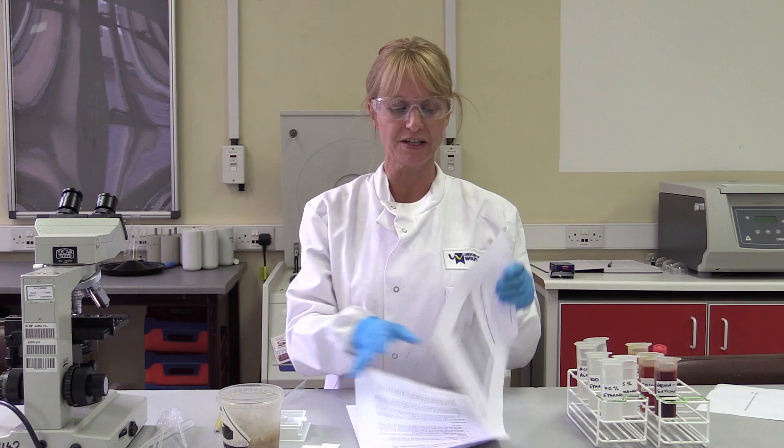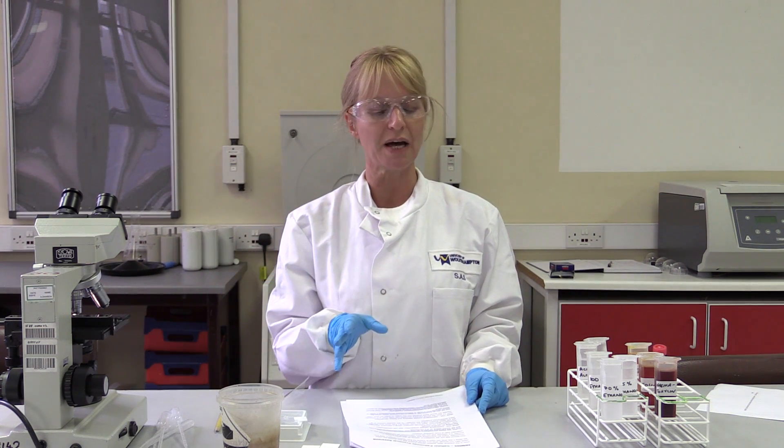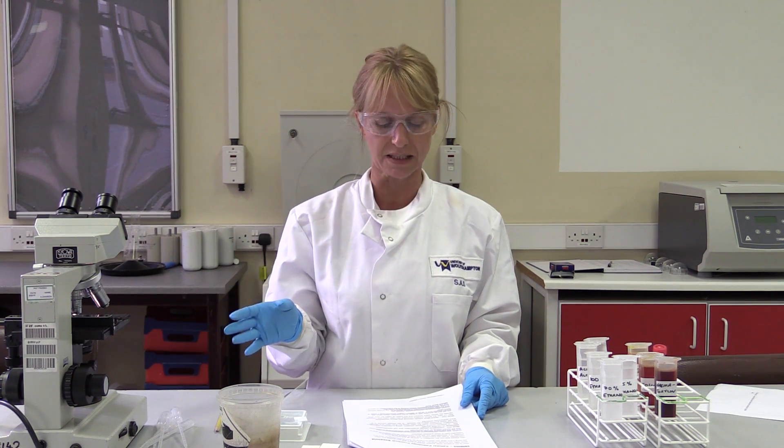If you look at the first page of the booklet, you've got details of what you need to do before you start the practical. In your first year you learned how to set up the microscope, so make sure you can remember how to do that. It's really important that your microscope is set up correctly so you can see the cells and tissues, because part of this practical is to identify different things.